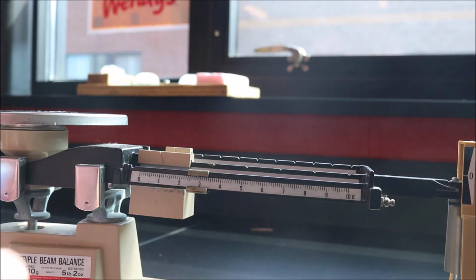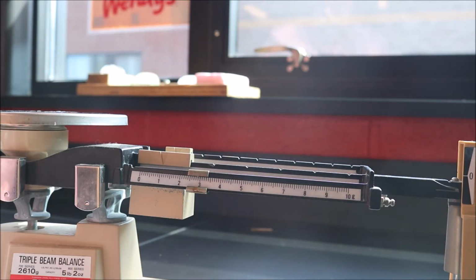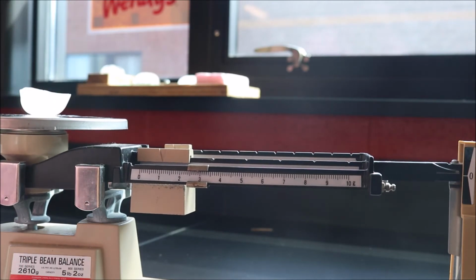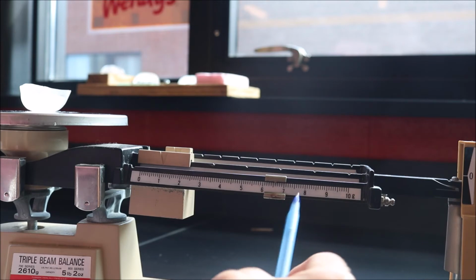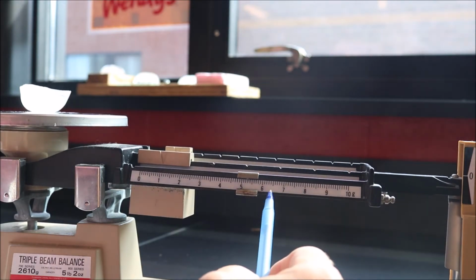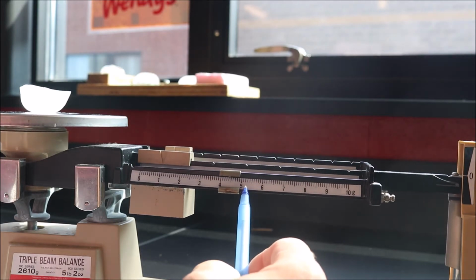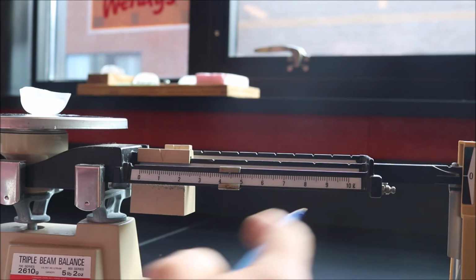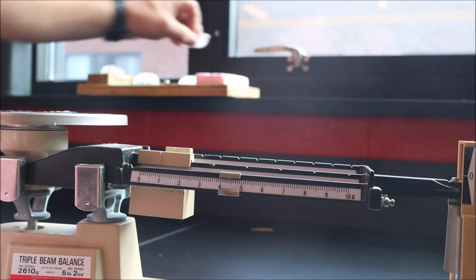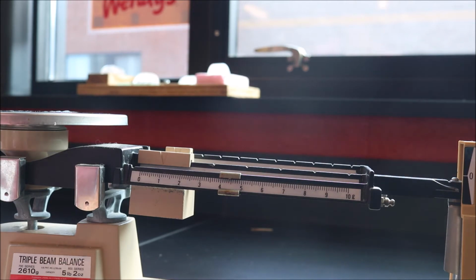Ice cube number 3 is 12.9. Oh, it's trying to get away. There we go. Okay. And then, let's see here. Ice cube number 4. All right, ice cube number 4 is a little bit bigger again. So we're going to say it's 15, not 14. It's 14.5. We'll say 14.5 grams. Put it on there. 14.5 grams.